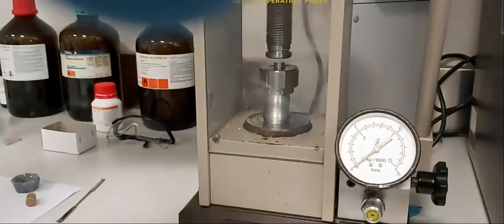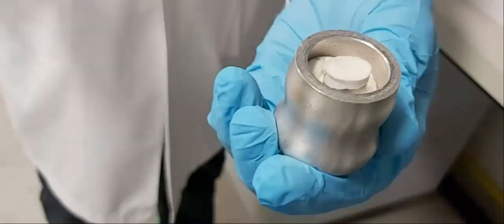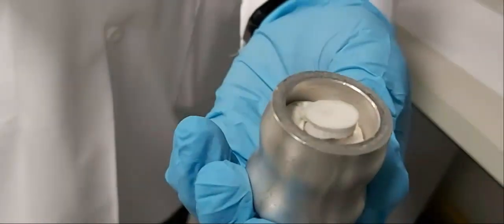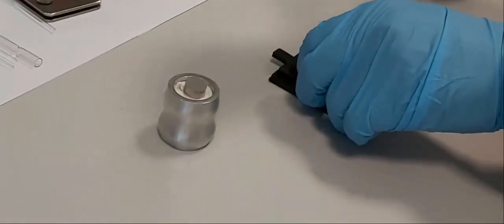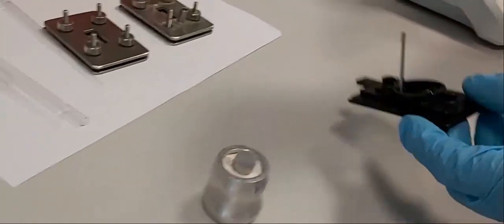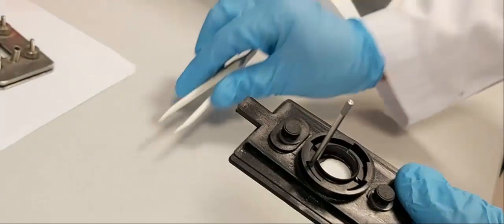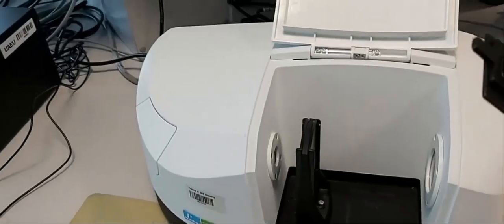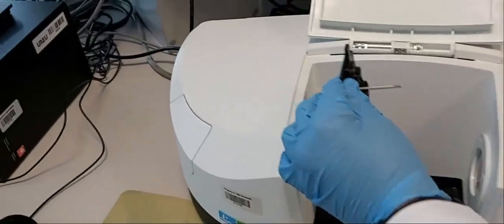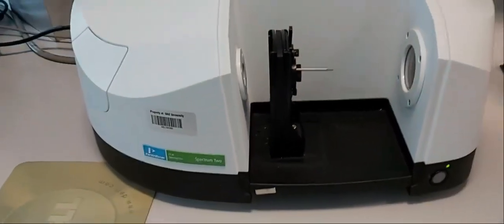We have our disk — this disk contains KBr and our acetanilide sample. We fix this disk in the pellet ring holder using the same method, securing it with the small piece. Then we fix the whole holder containing the sample on the IR apparatus and close the door.